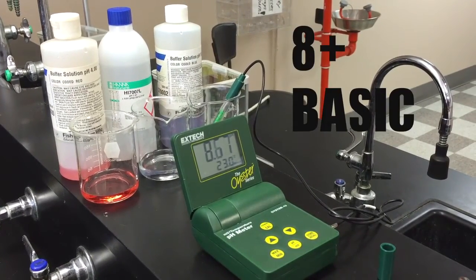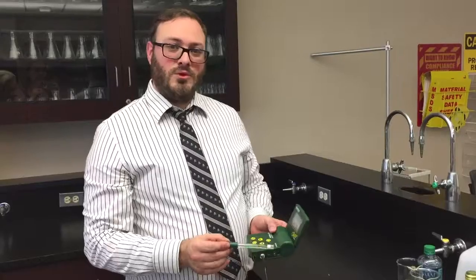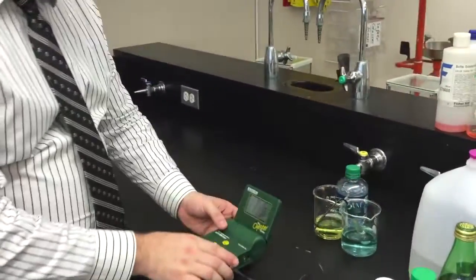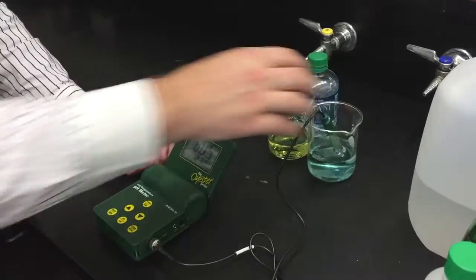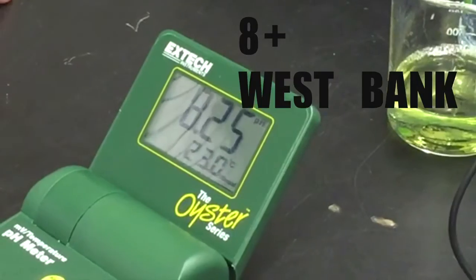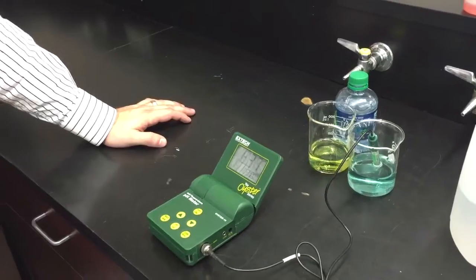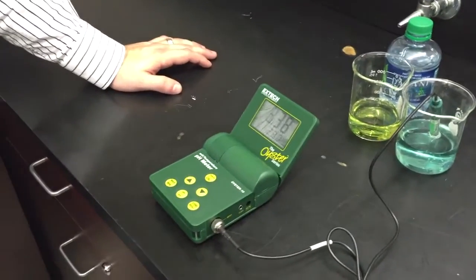You'll see a lot of the alkaline waters pushing for pHs of 8 to 10. So we want to go ahead and get a standard for the water in the West Bank as a pH. As we start to look at the pH, we're actually seeing that the tap water is actually naturally basic or alkaline, and we're seeing a pH of about 8.3. We want to point out that there is a color indicator in here — we don't have blue water on the West Bank.